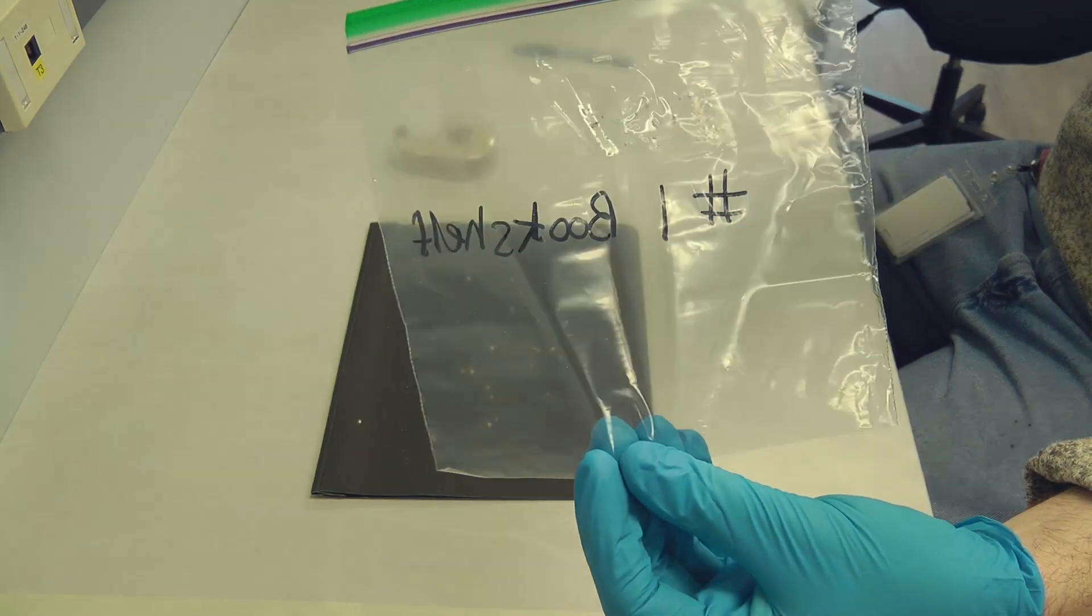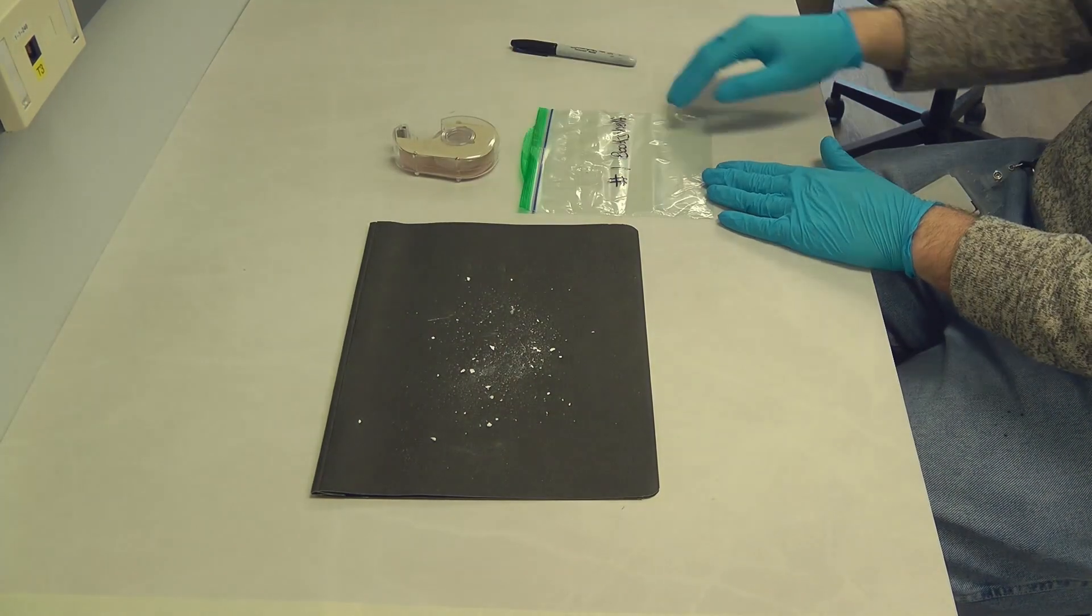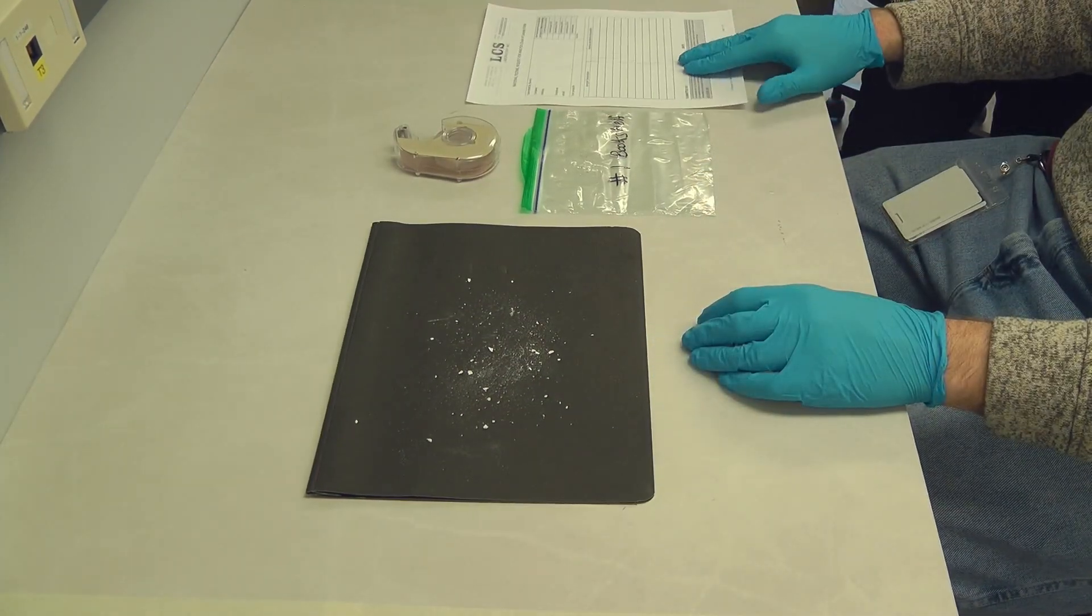If you need to take another sample please repeat the same sampling procedure with a fresh piece of tape and a new ziplock bag.